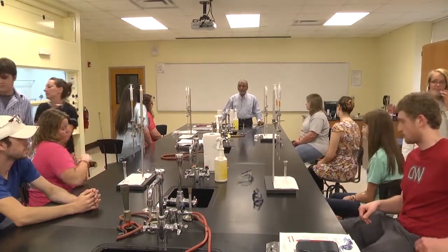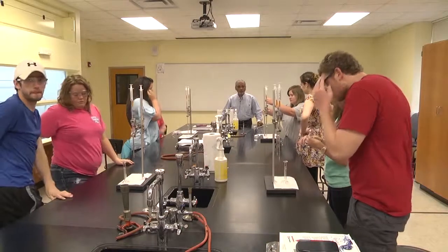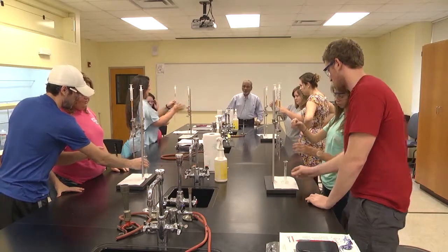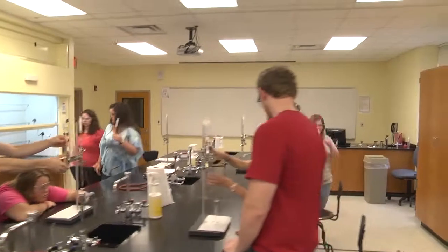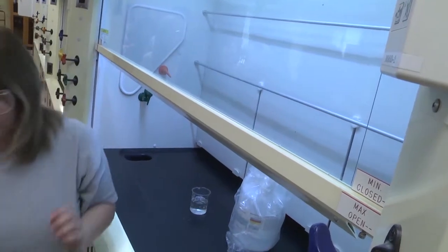All right, and you use the 2 burettes. In one burette you will take the sodium hydroxide, and in another burette you will take vinegar, and use the phenolphthalein as the indicator. Okay, all right, let's go ahead and start. Make sure everybody has safety goggles. Okay, very good.